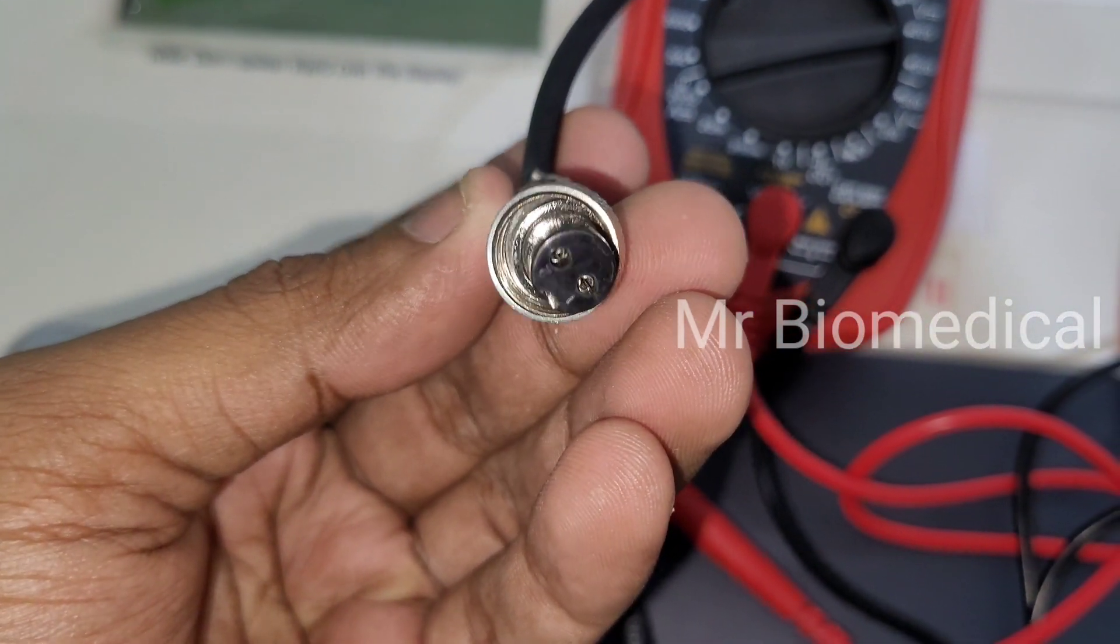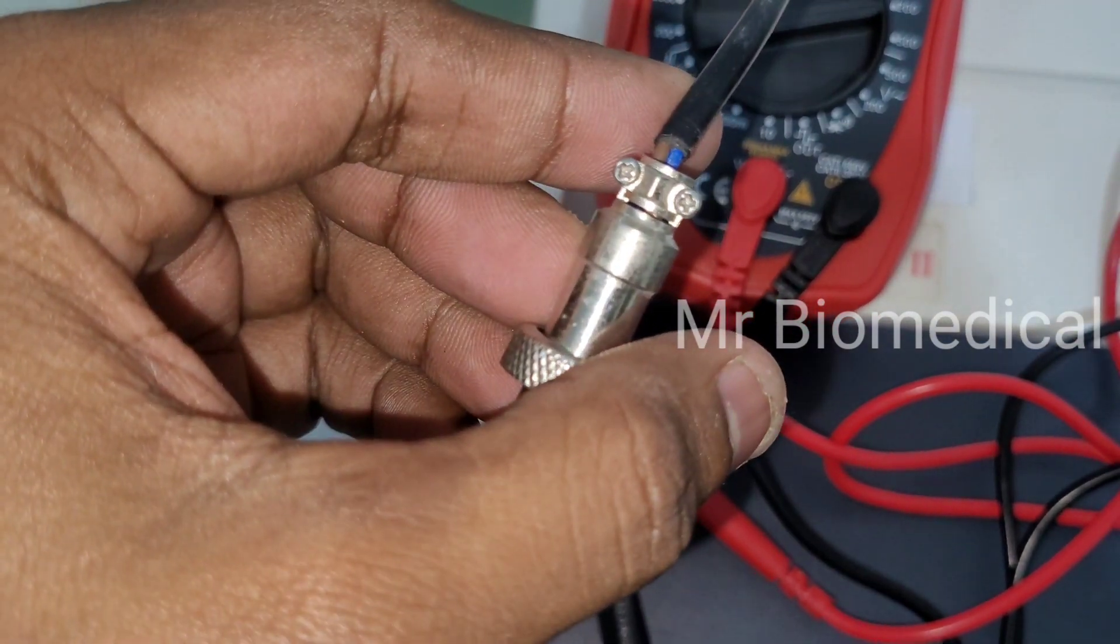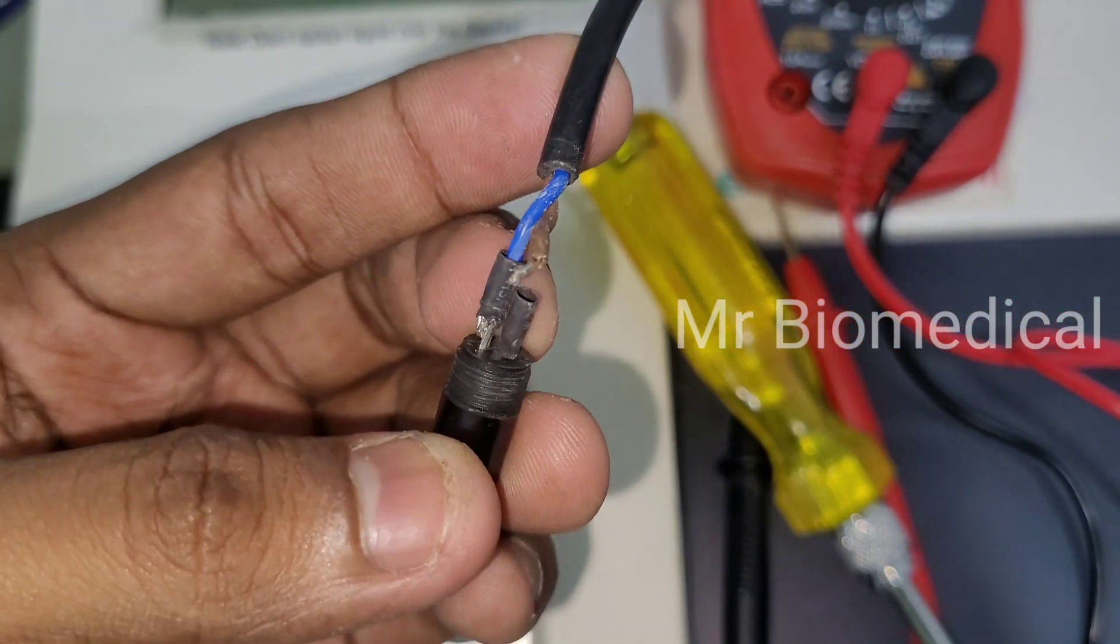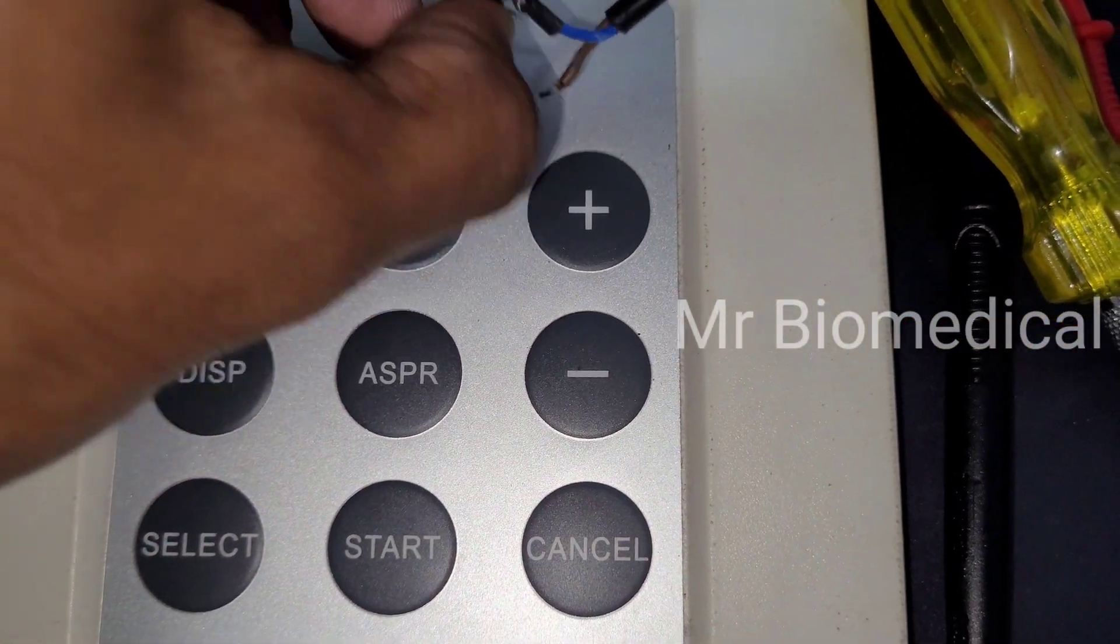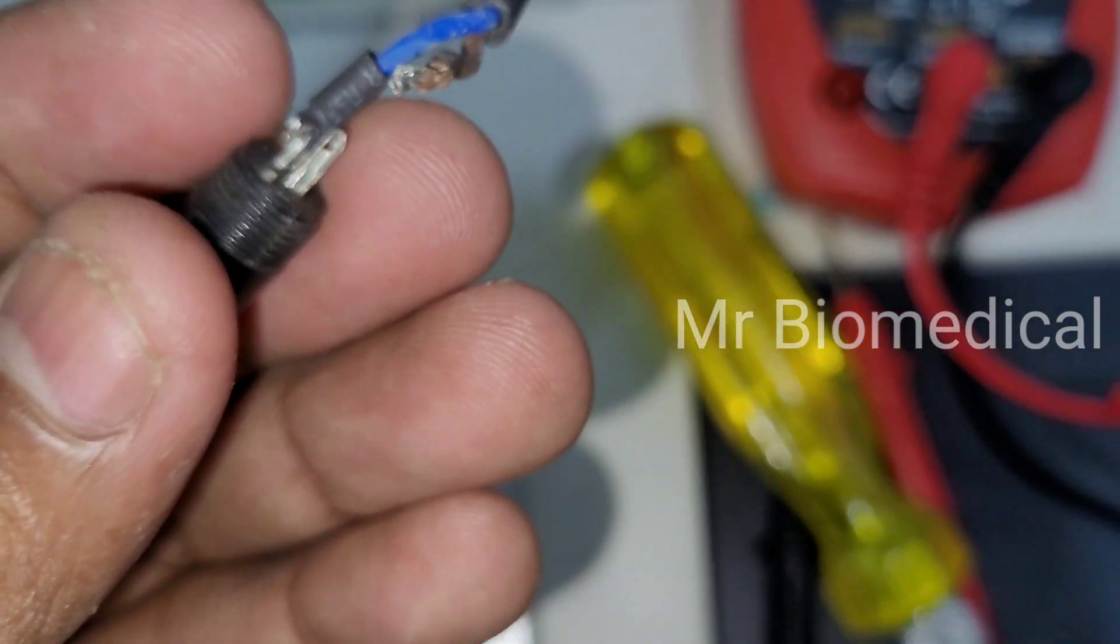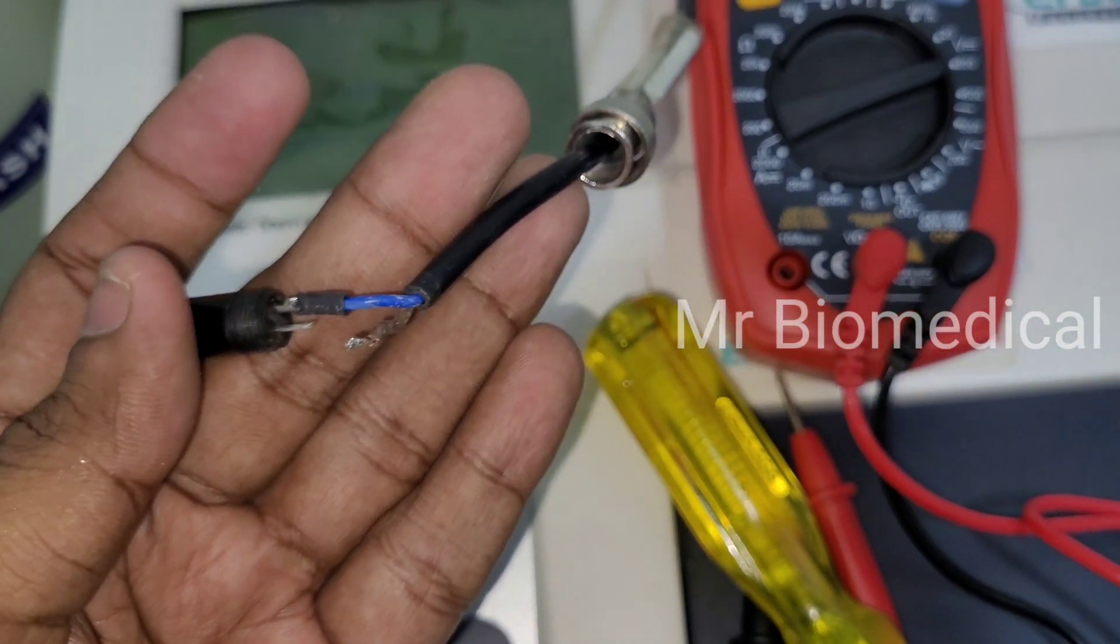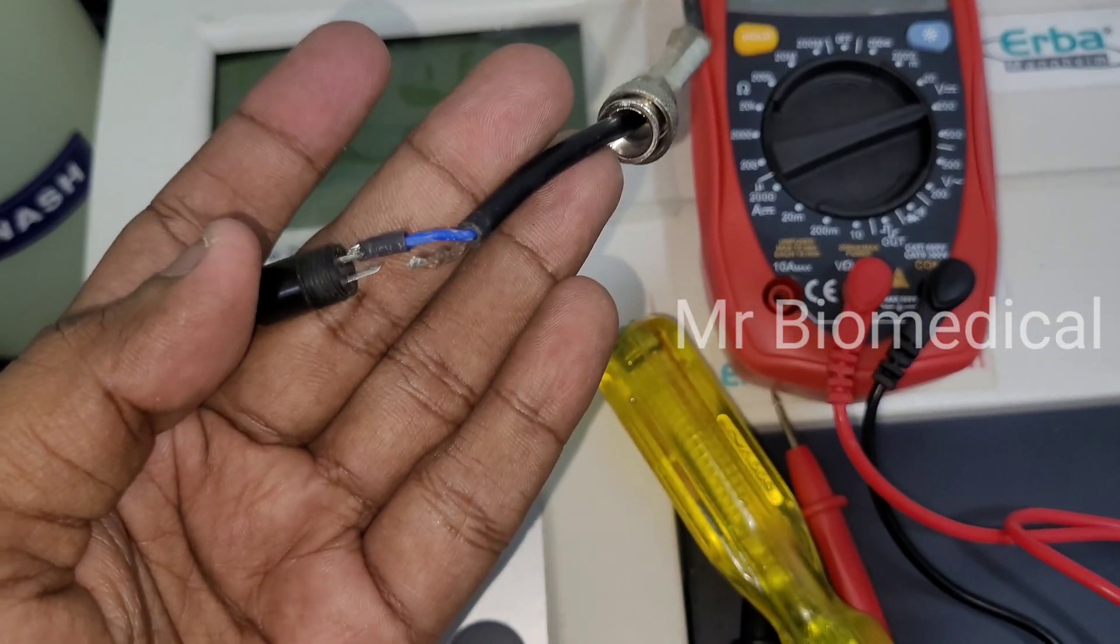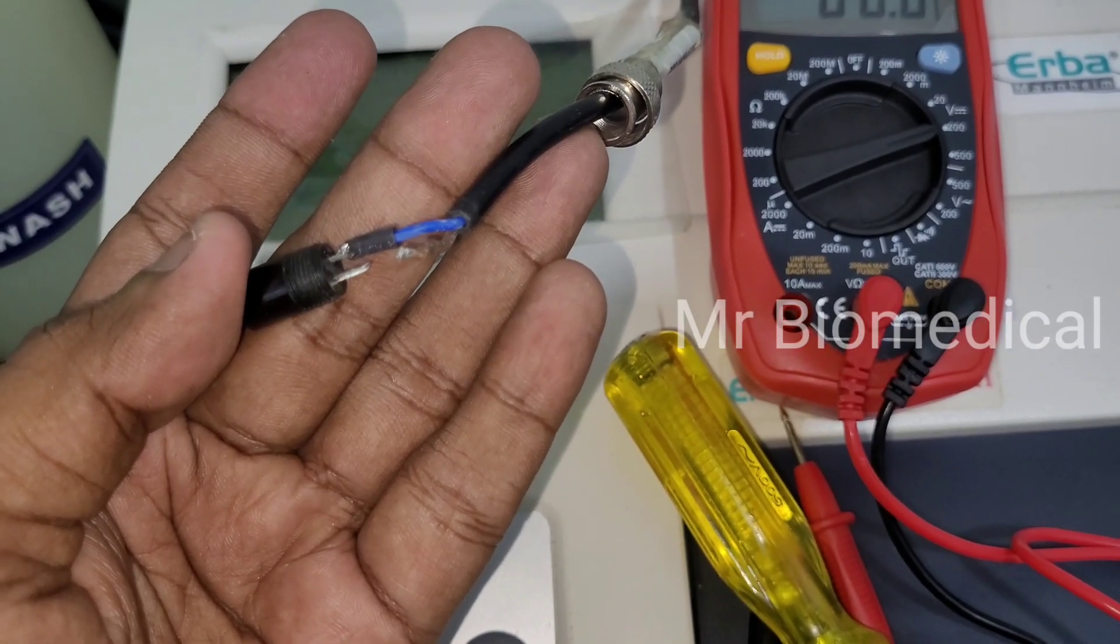So let's remove the connectors and see if wires are fine or not. I guess already one wire came up from the pin, so I should resolder this into the pin and we can see whether the DC pump will work or not.